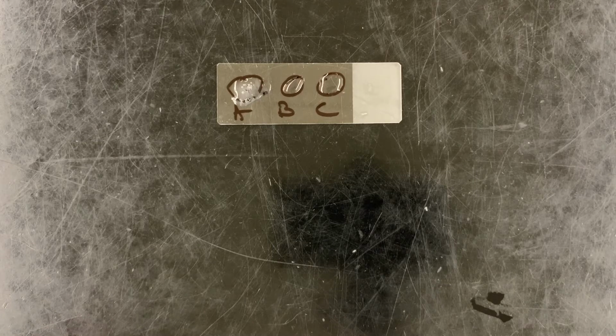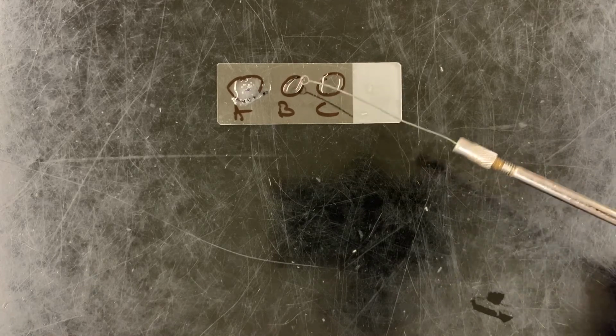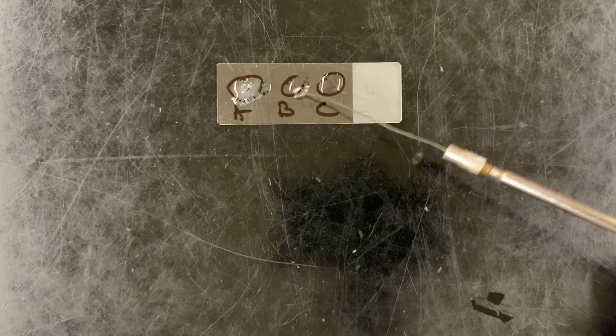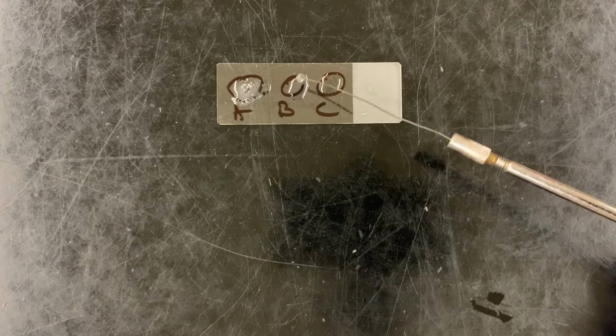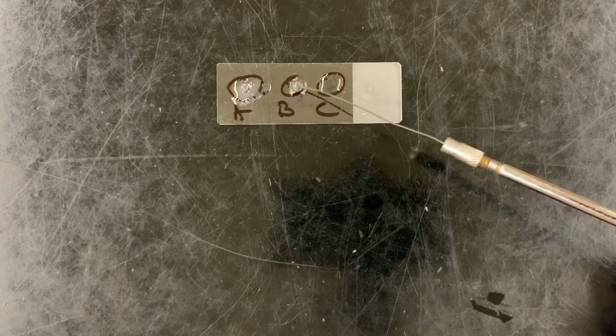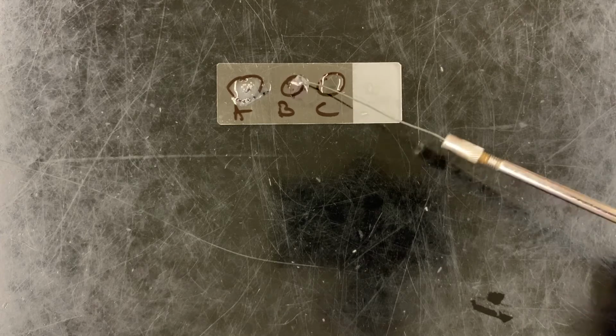Here now we have bacterium B, and let's see what this fellow does. Once again, I took this under the microscope and I said, oh, it looks interesting. It's not quite the classic strep that I normally see in the textbook, but I believe it to be strep.